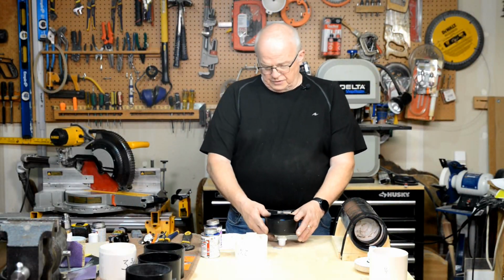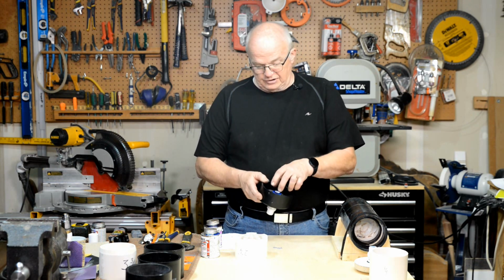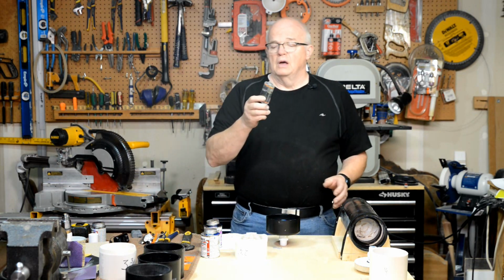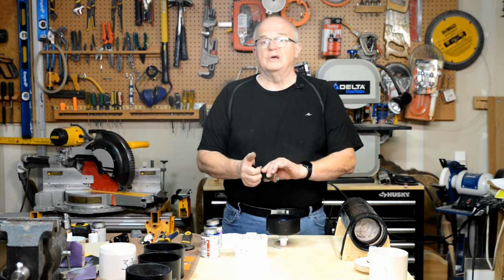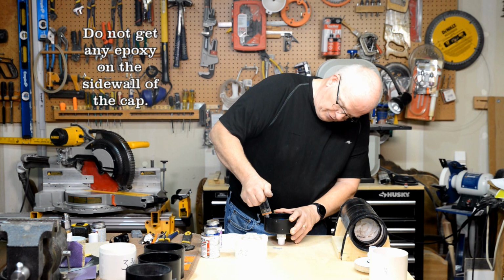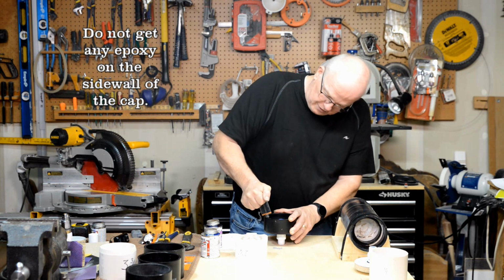All right, now that we've got it that far, here's where we take out a little insurance against this thing leaking at all. And how we're going to do that is we're going to take the other half of this two-part epoxy here, and we're going to squeeze it into what we've got going on so far here. So this squeezes in there very effectively. You get a whole bunch of it down in there.